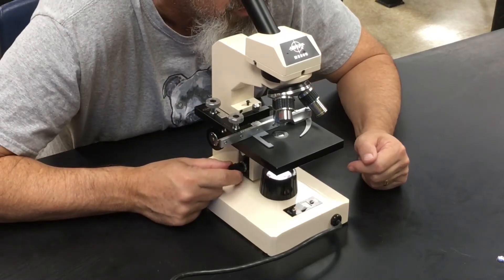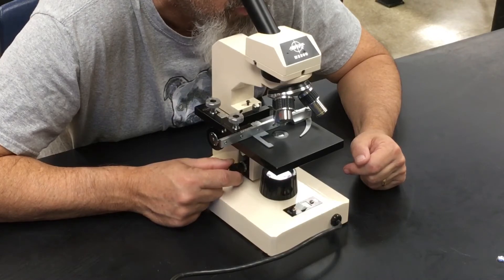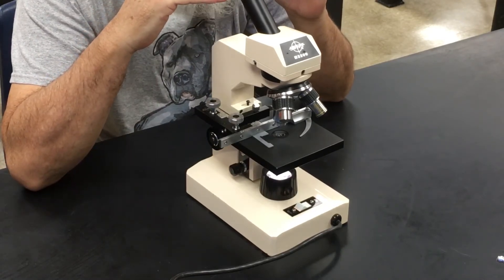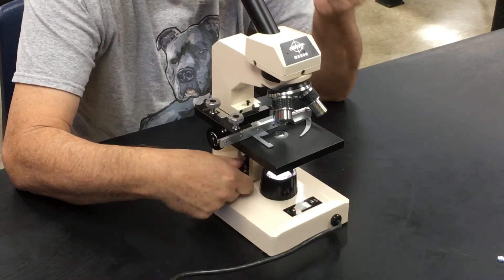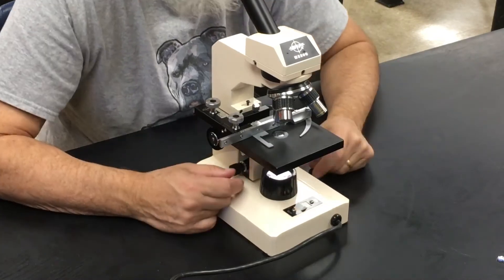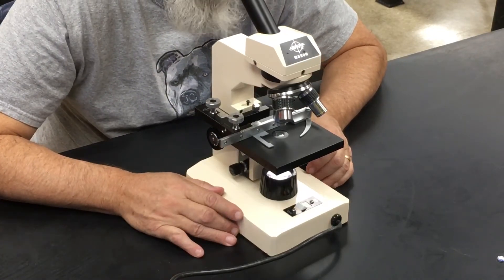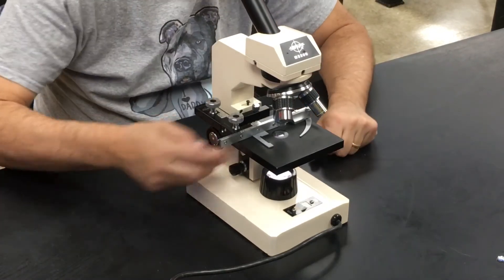It won't be perfectly in focus, so you slowly turn the fine focus knob — not the big one, the small one — slowly away from you until your object starts to come into focus. If things are becoming more and more blurry, reverse direction and turn the fine focus towards yourself until something comes into view. Always start by turning away from you — that's the safe bet, and most microscopes are properly adjusted so that turning away finds focus under high power.